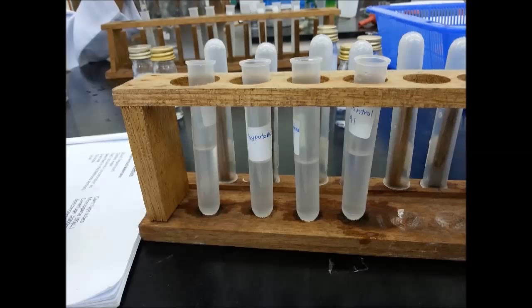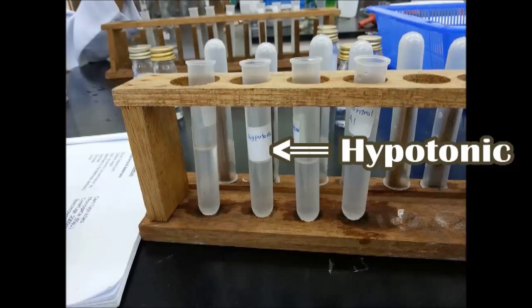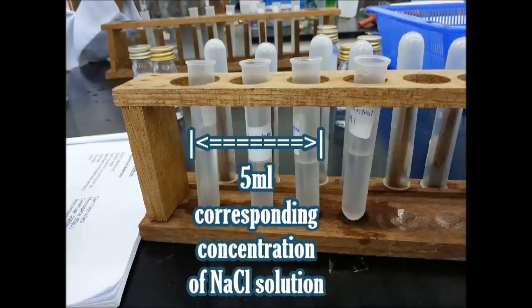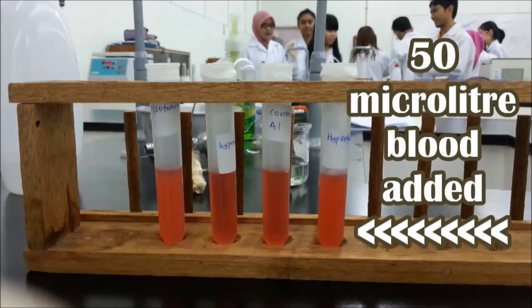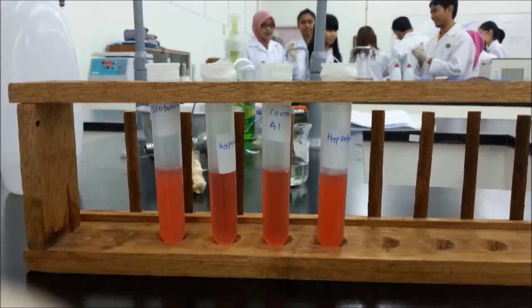Four test tubes are labeled as hypertonic, hypotonic, isotonic, and control. Three test tubes are filled with 5 ml of the corresponding concentration of sodium chloride solution and the fourth one with distilled water. 50 microliters of blood is added into each test tube using a micropipette.